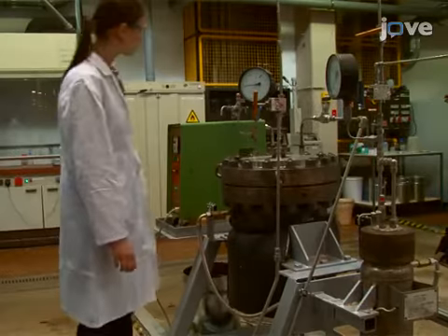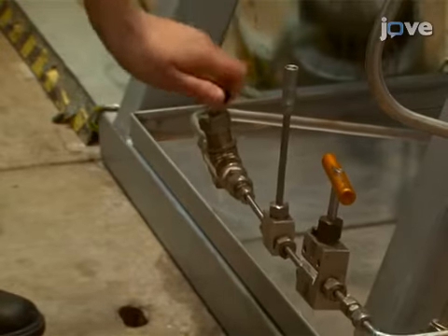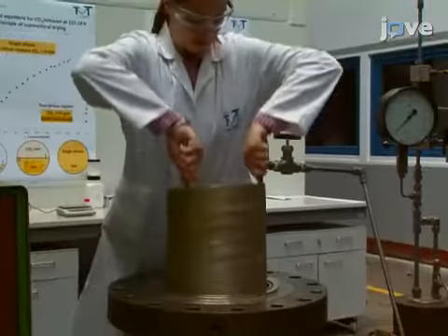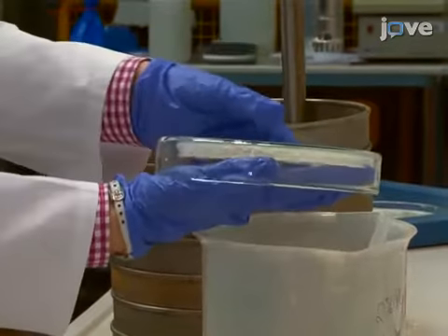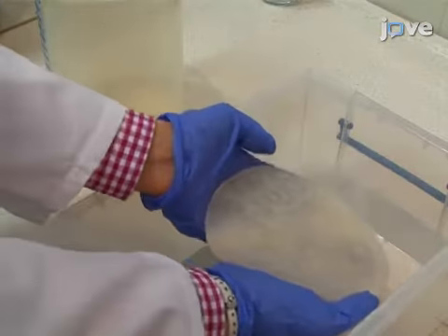After gelation, slowly depressurize the autoclave at 0.2 megapascals per minute. Any quicker and the gel can break. When fully depressurized, open the autoclave and remove the molds. Remove the hydrogels from the molds by turning them over and, if necessary, pry them out with a spatula. A perfect hydrogel looks homogeneous.